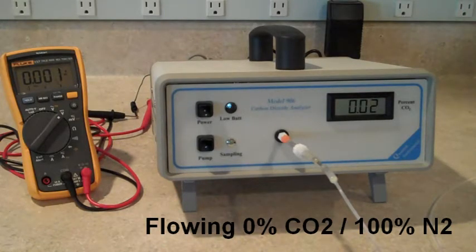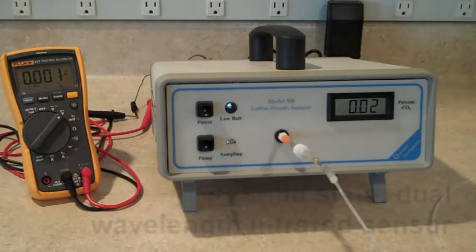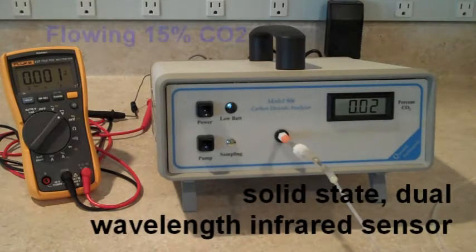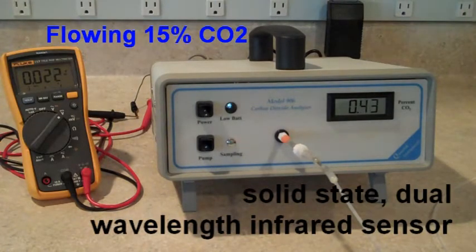The internal sensor is a solid-state, dual-wavelength, infrared CO2 sensor with no moving parts, and thus has a theoretically unlimited lifetime.